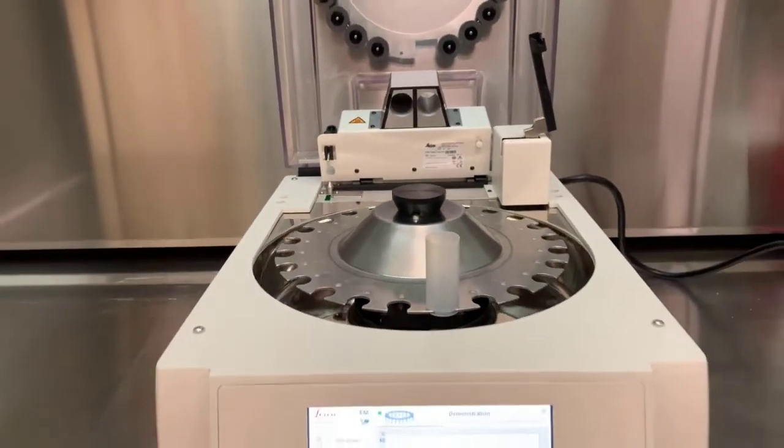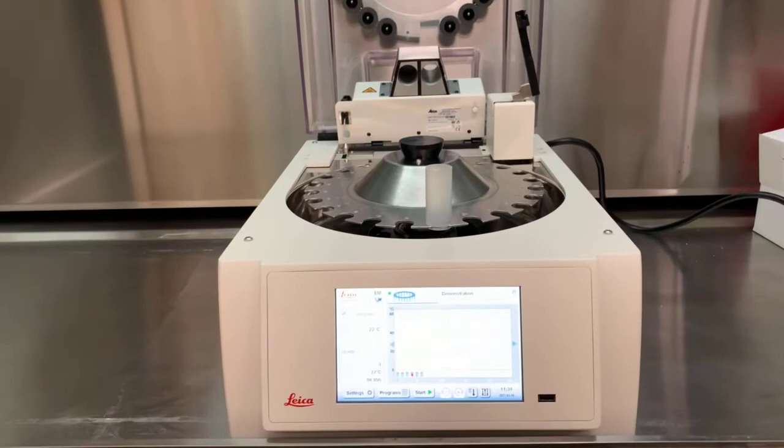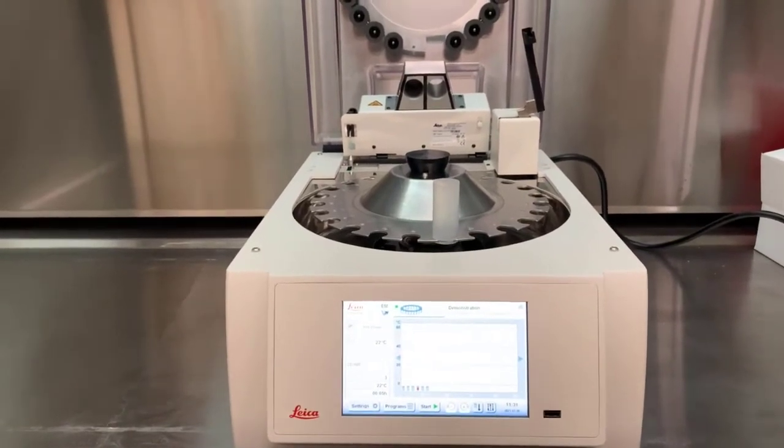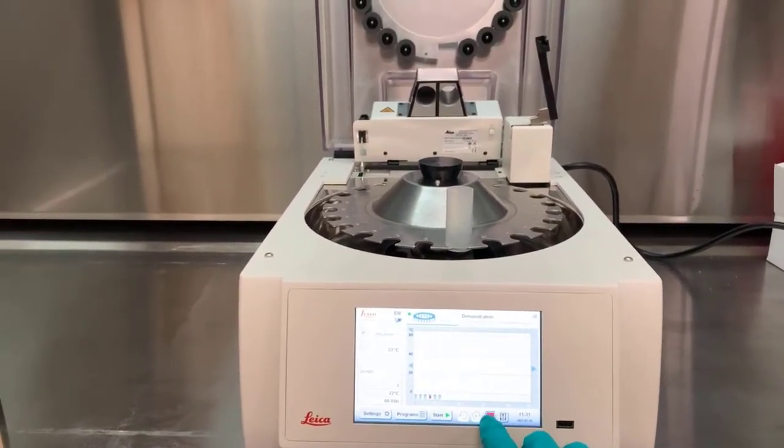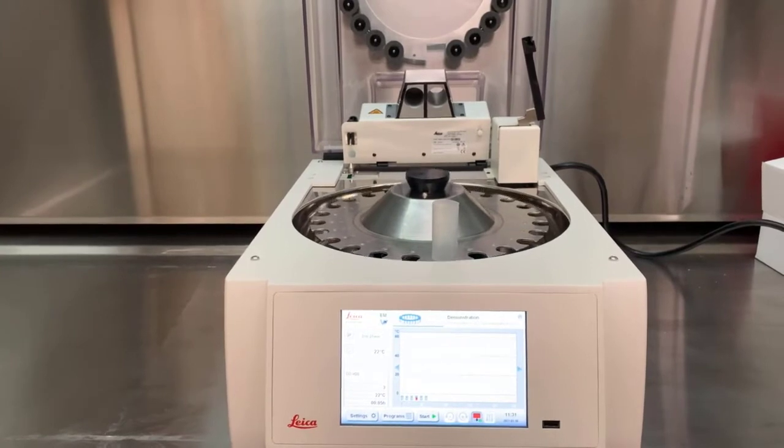The carousel needs to be screwed securely in place. Samples can be loaded with the carousel either on a bench top or directly onto the EMTP.